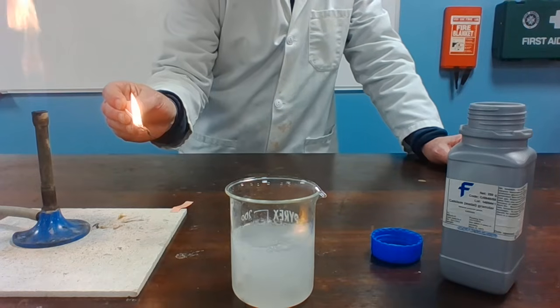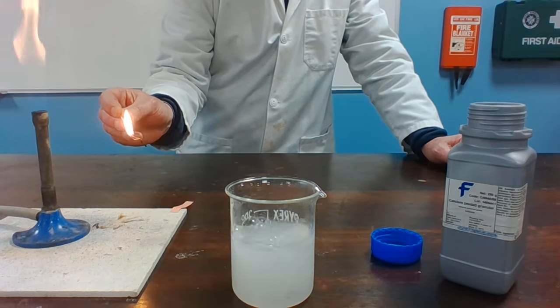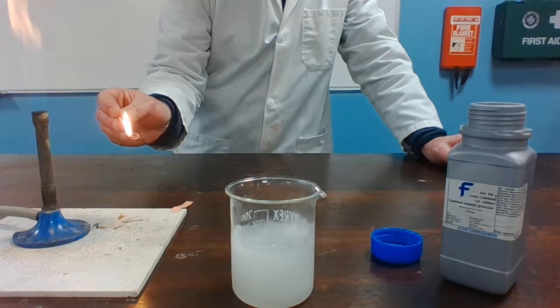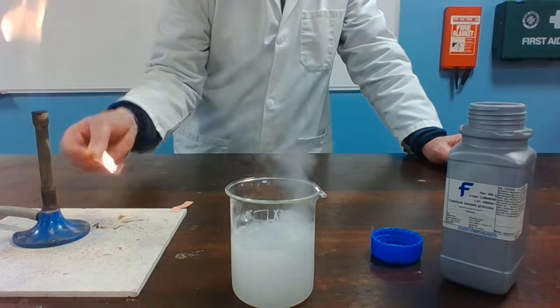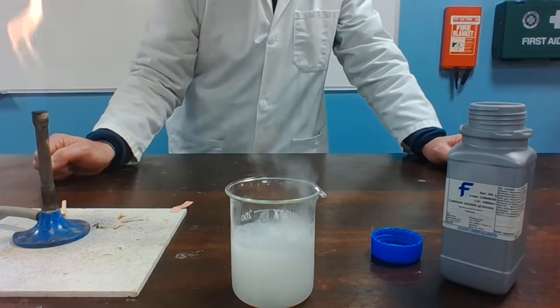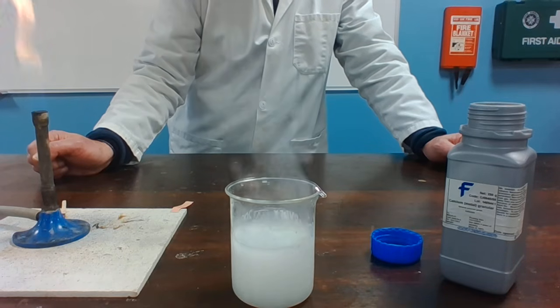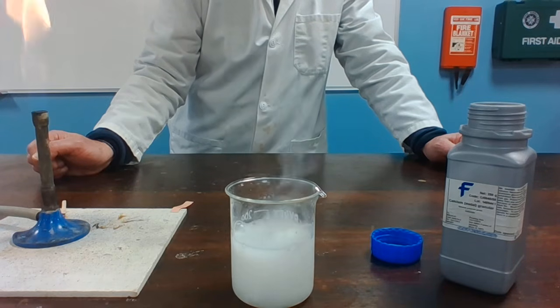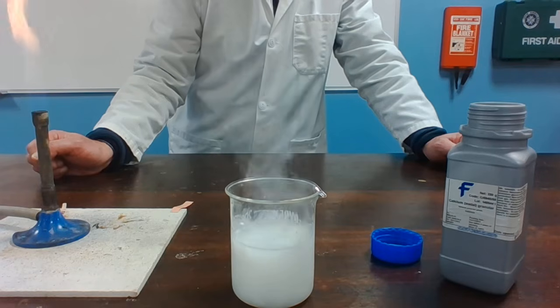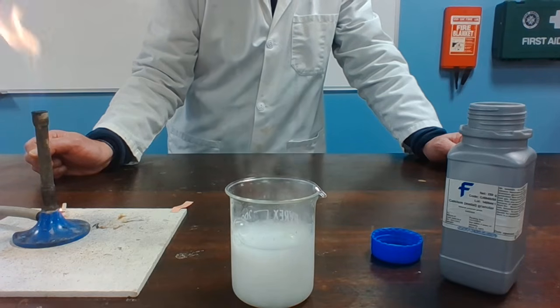The solution is also going a little bit cloudy because the calcium hydroxide that's also formed is only slightly soluble in water, whereas with the reactions of sodium and potassium, the sodium hydroxide and the potassium hydroxide are totally soluble in water.